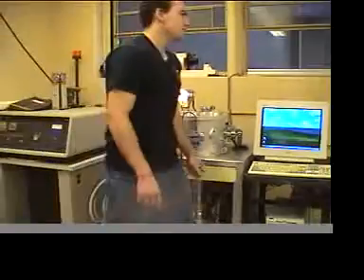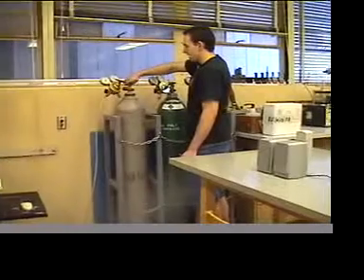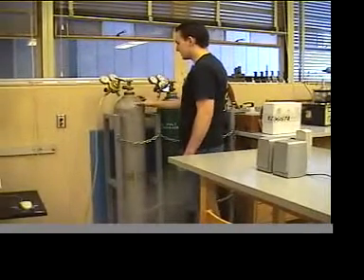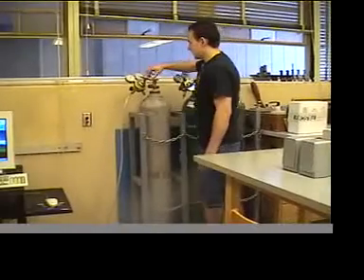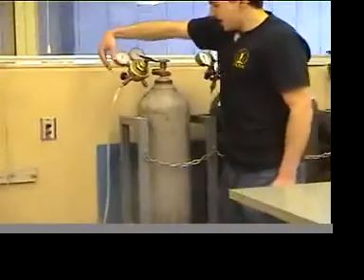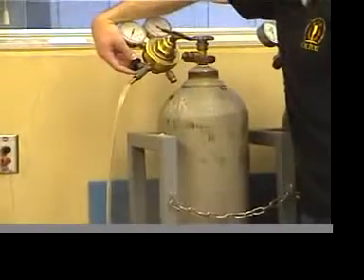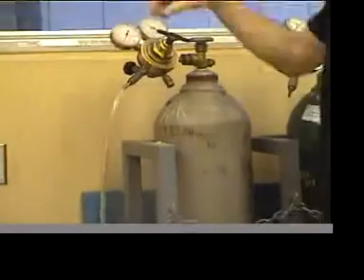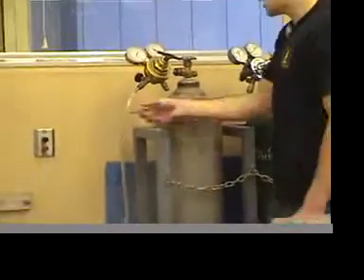Once that's done, you can come over to the gas tank here. You unscrew this for a little bit and close it. That'll let some of the pressure from this large tank into this small tank. Then you can see how much pressure's in there, and you can open this knob to let some of the pressure come into this tube. You want to close it pretty quickly because you only need a little bit of the sample to analyze.